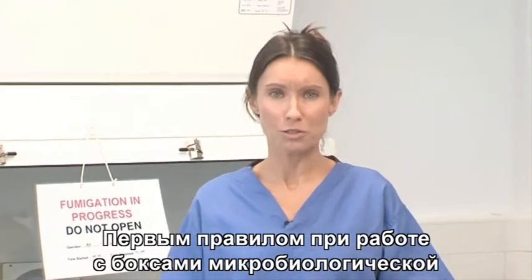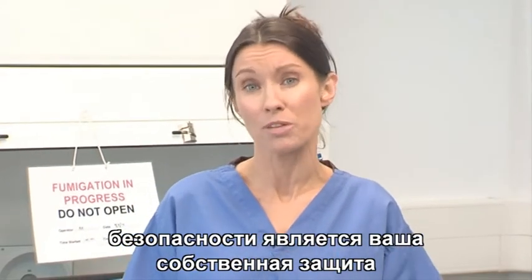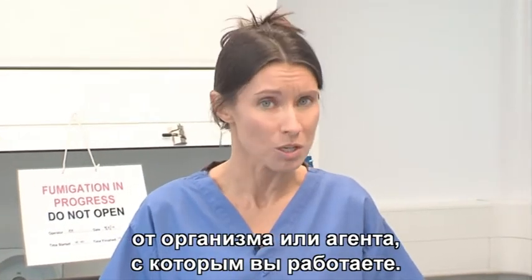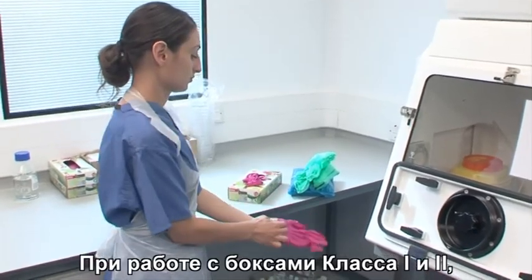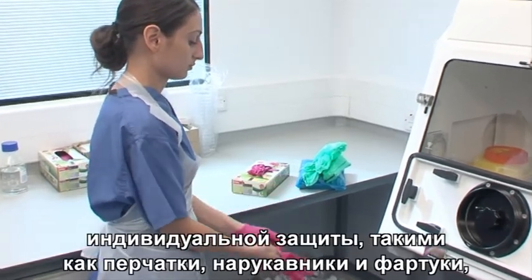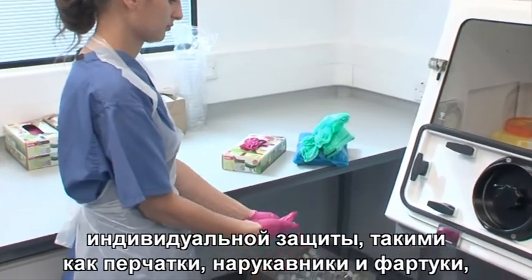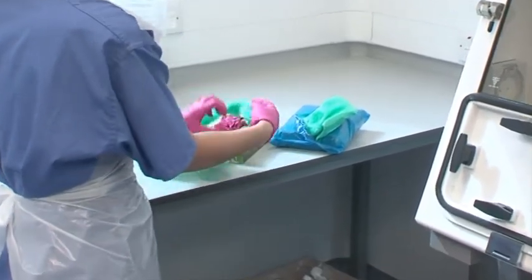The first rule when working with microbiological safety cabinets is to protect yourself from the organism or agent that you're working with. For Class 1 and 2 cabinets, basic personal protective equipment such as gloves, sleeves and aprons should be used, as the operator's arms will be extended into the cabinet.